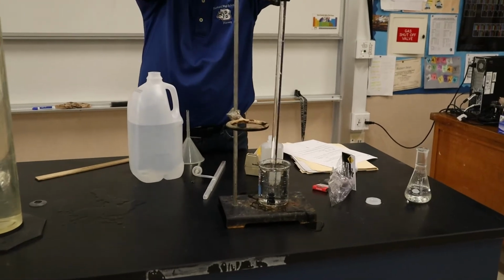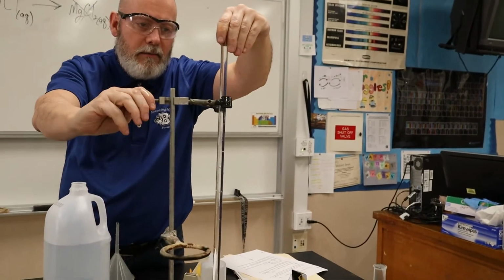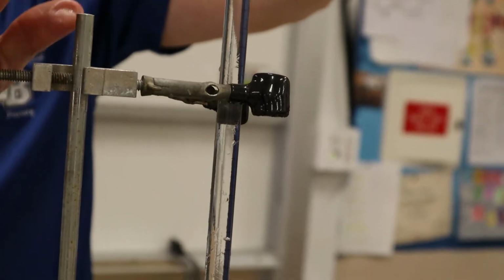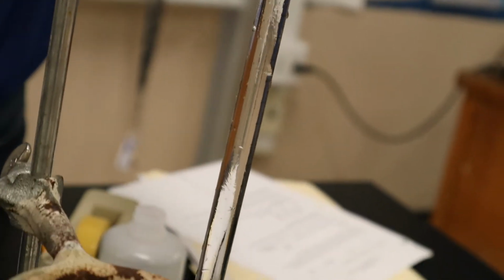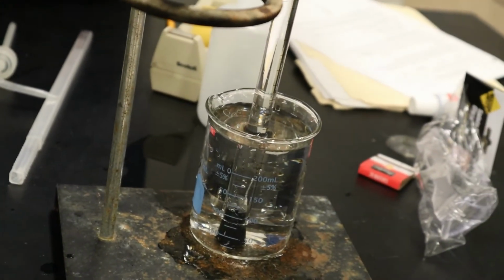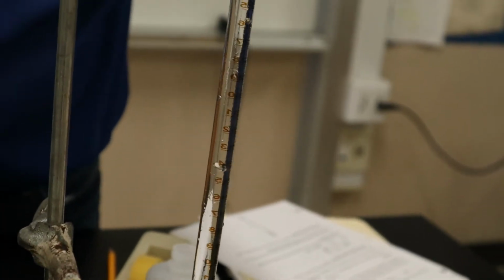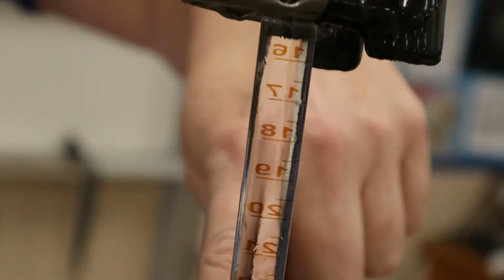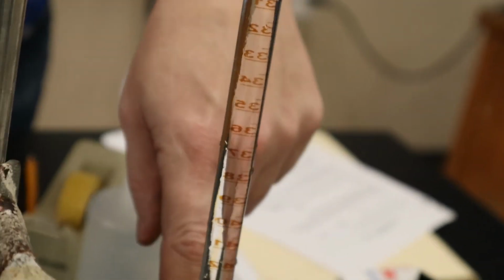Now, if you zoom in, Mr. Iwan, you can see the acid sinking down, right? If you look carefully, you can see the acid sinking down into the water, and it's going to start touching the magnesium down at the bottom there. Okay. Let's see if I can use this thing. Okay, all right, we can lean that up against there. That's good. But you can see the acid sinking down. It's kind of cool. It's almost like a lava lamp. See how it comes down? Remember the acid is actually heavier than the water, so when I turn it over, it started sinking.